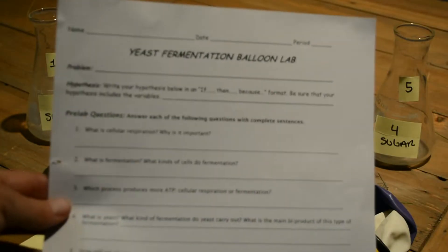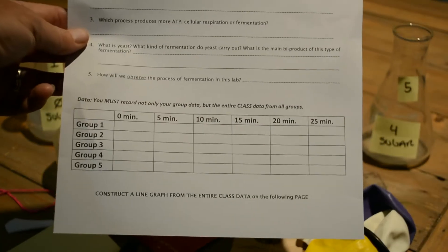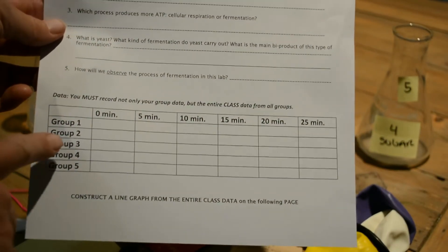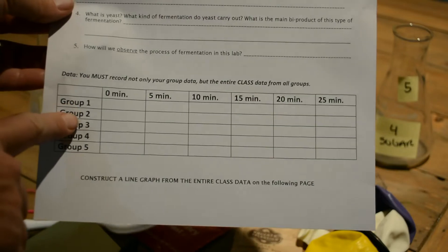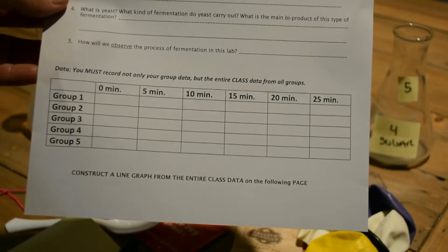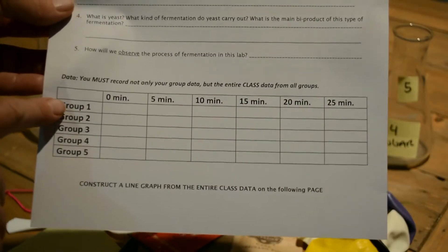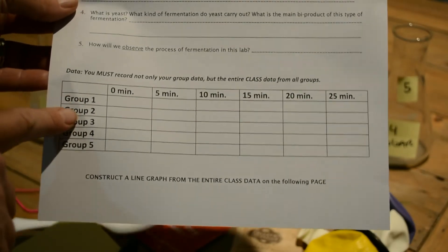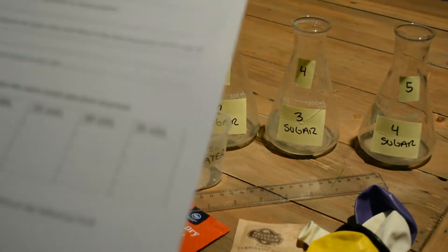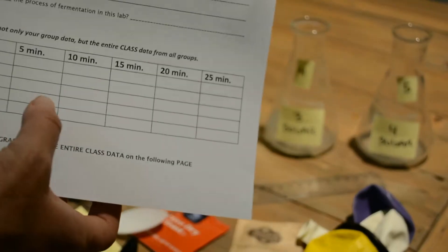I'm going to show you the data, so you'll be writing down all the data for the different groups — beaker one through beaker five. Make sure to note that beaker one has no sugar and beaker two has one pack of sugar. Everything is labeled right here.